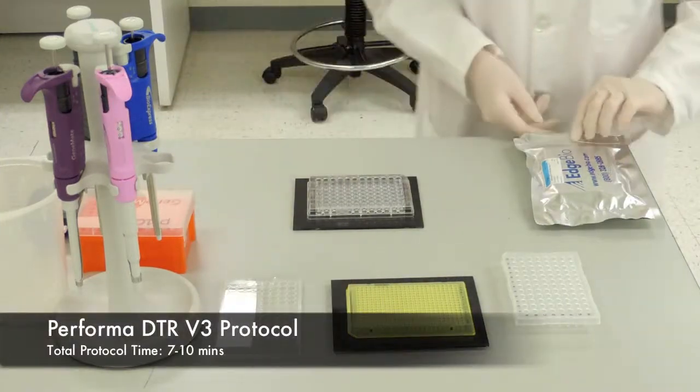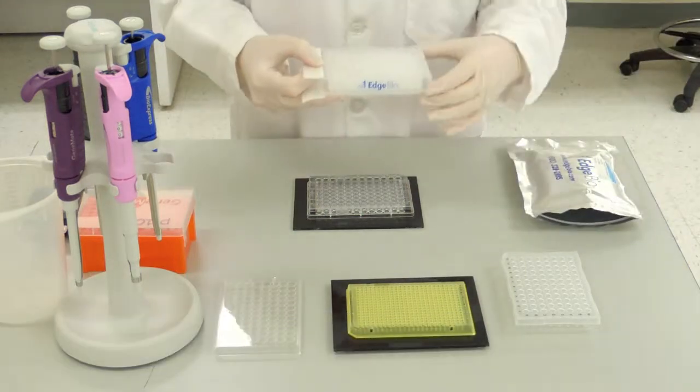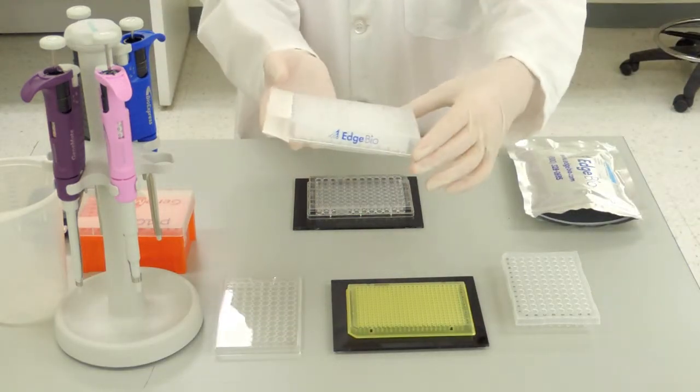The protocol for Performa DTR plates involves a few simple steps with a total processing time of 7 to 10 minutes.